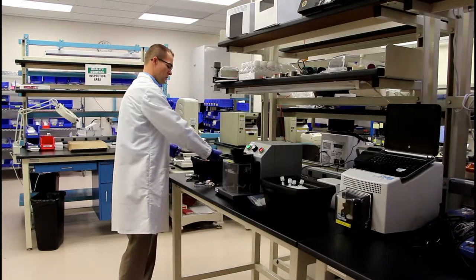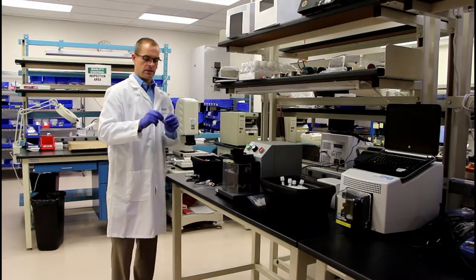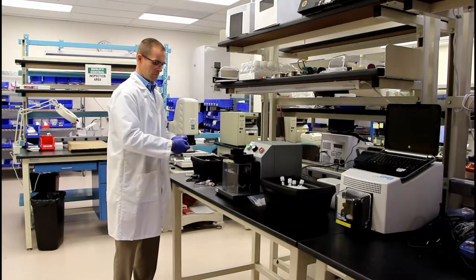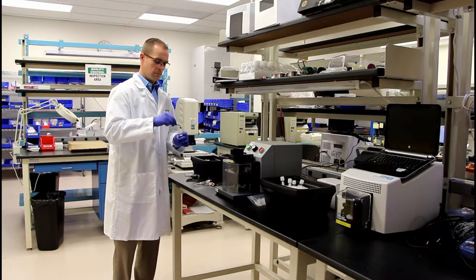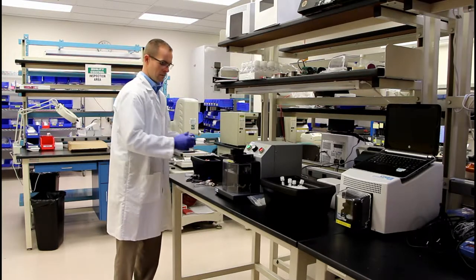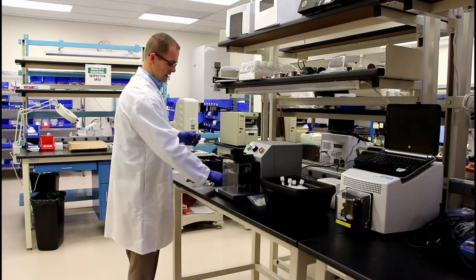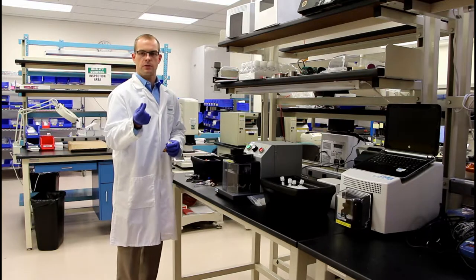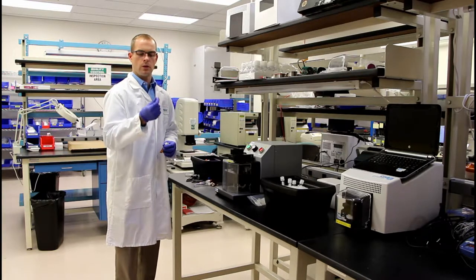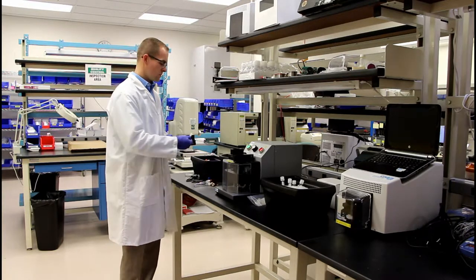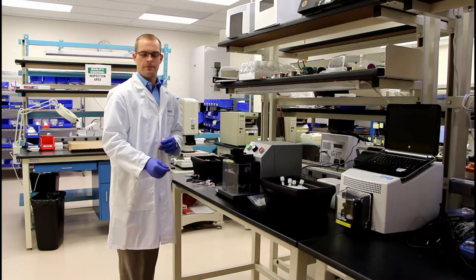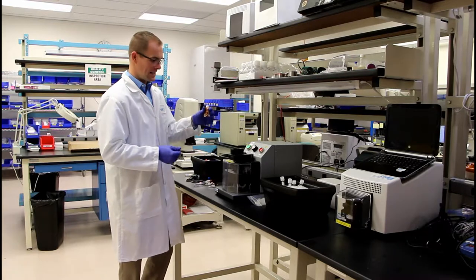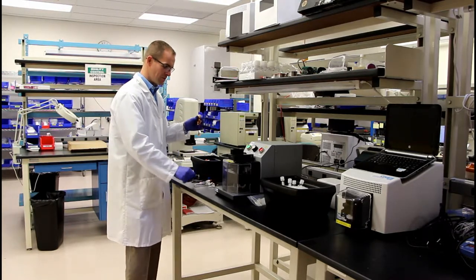To start, you will take a tissue sample and place it into the tissue bag. If your tissue sample is frozen onto your Eppendorf PCR tube or cryo vial, you're going to have to pry it out and get it into the tissue tube.